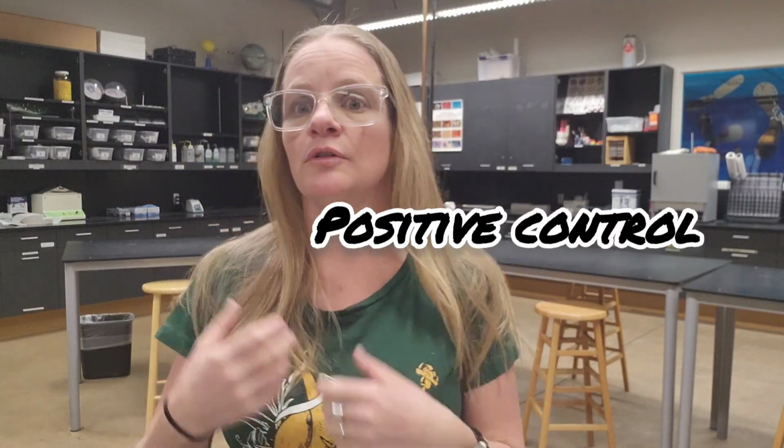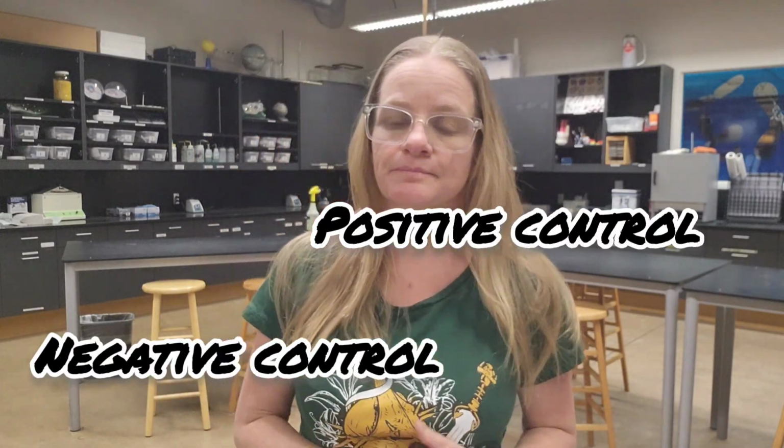Today we're going to be looking at common food items and testing them for the biological molecules that we've been discussing in class. We're also going to dig in a little bit more to some of the terms that are commonly used in science, specifically the terms positive control and negative control.